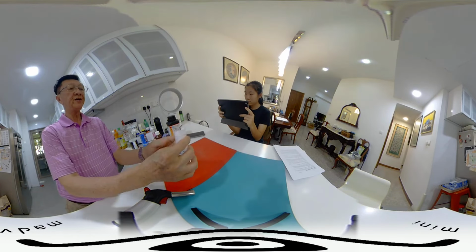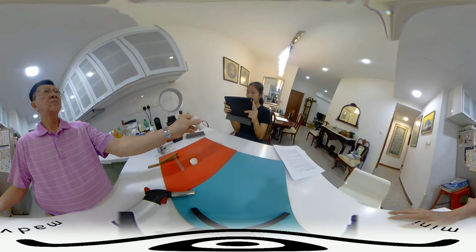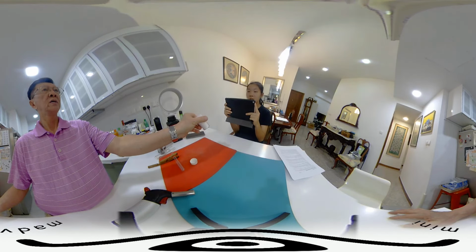Okay, here I have a white powder. What's the formula for this white powder? ZnO. ZnO, right?